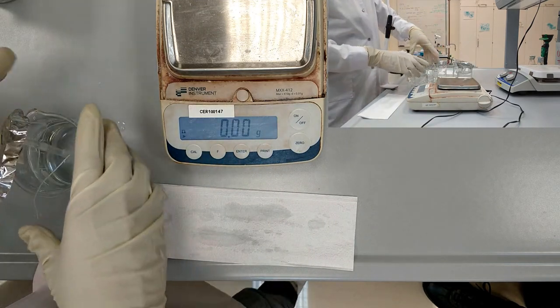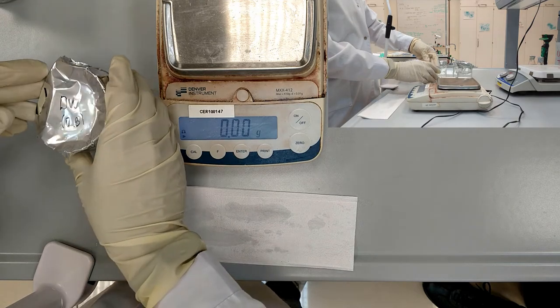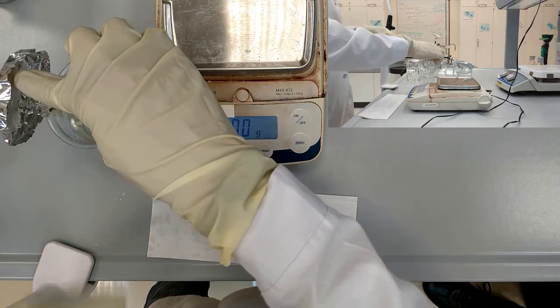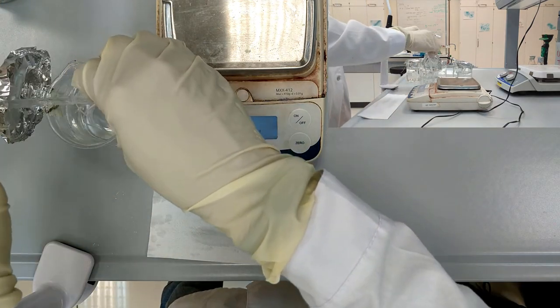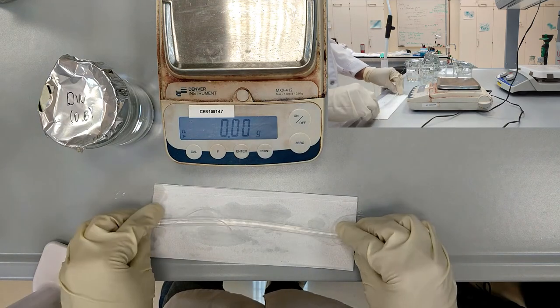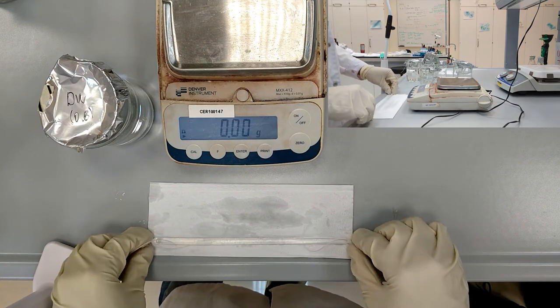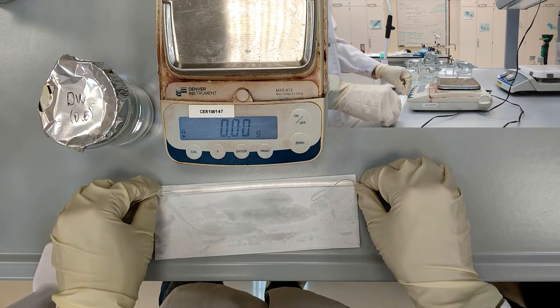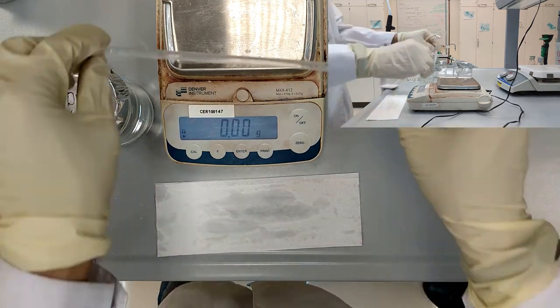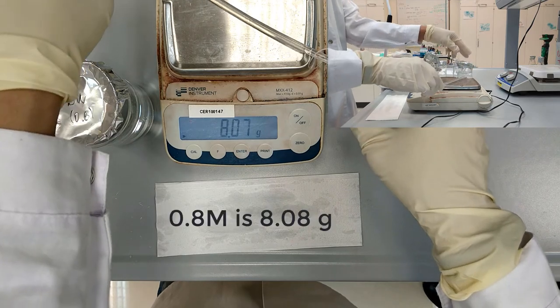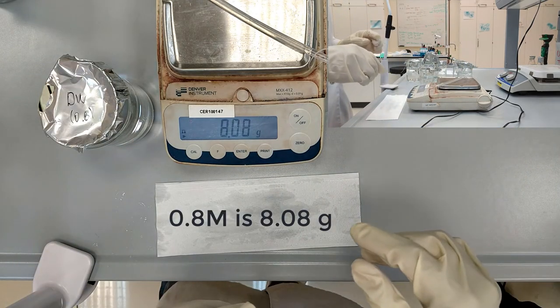Next we take the 0.8 molar concentration inside the tube. After drying it, we also determine the mass. It is 8.08 grams.